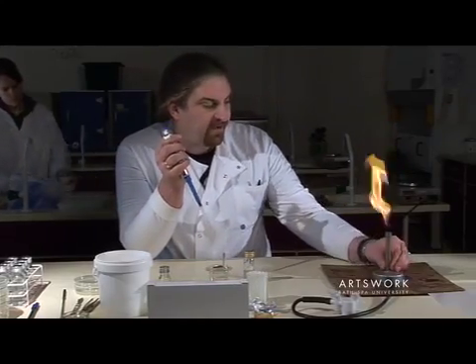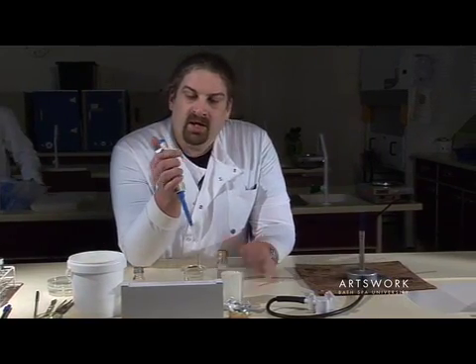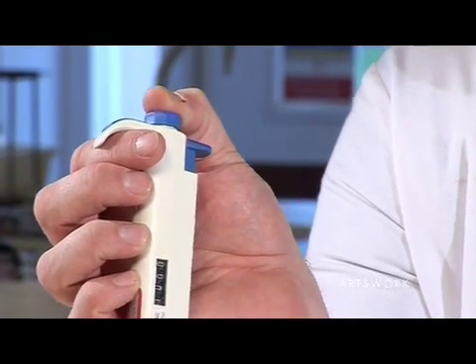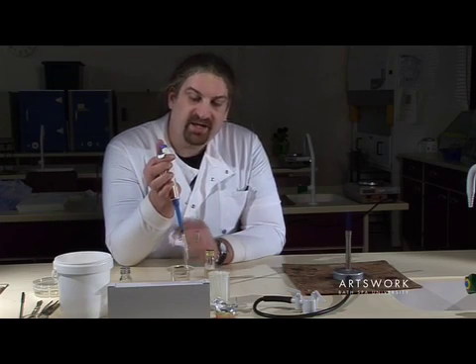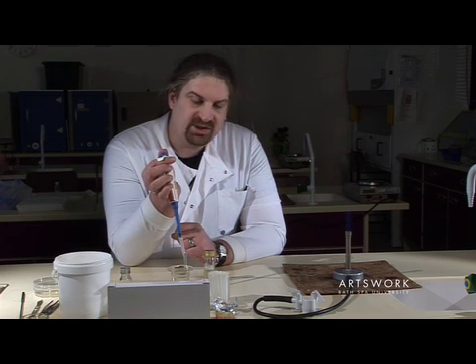To transfer a sample — using a bacterial culture here — the plunger has two stops. If you depress it gently it'll come to a natural halt, and then if you apply a little bit more pressure you can push it all the way down to the base. When using the pipette to pick up a sample, you need to depress it to the first stop only.